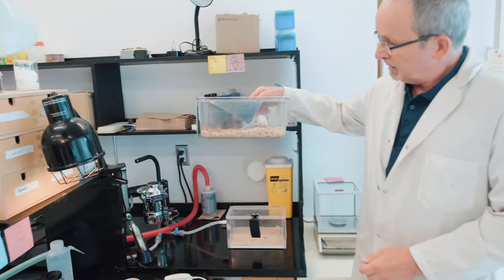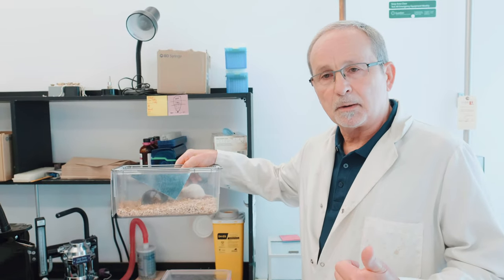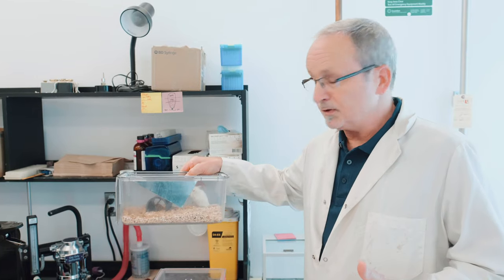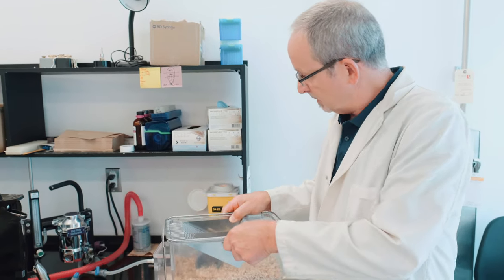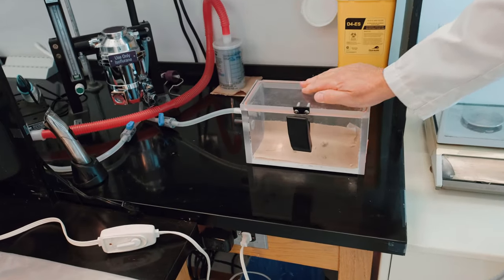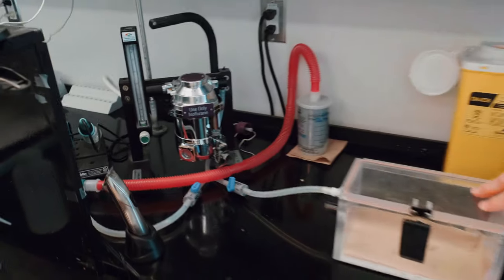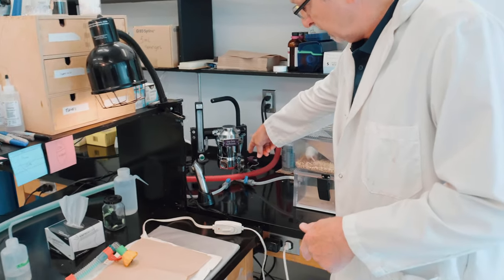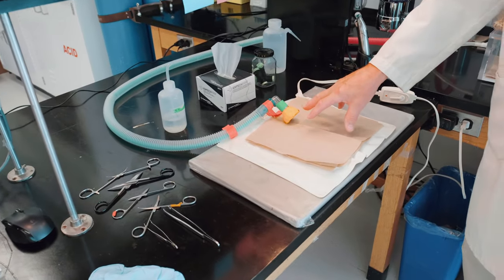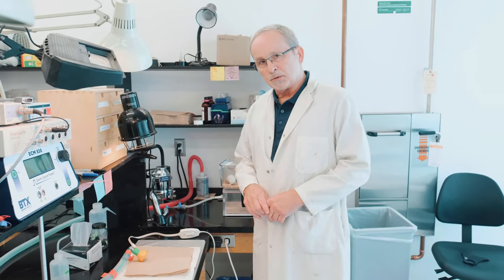Our mouse is a volunteer today and I'm going to do some surgery on him. His muscles will be used in the experiment to help explain muscle contractile properties, adaptations of muscle, and the role of different proteins in the muscle contraction and adaptation process. The first step is to take our volunteer and put him in this anesthetic chamber, which is connected to an isoflurane gas system. In a very short time the mouse will be asleep and anesthetized. I have surgical tools, gloves, and a mask that I'll use to expose the muscle.